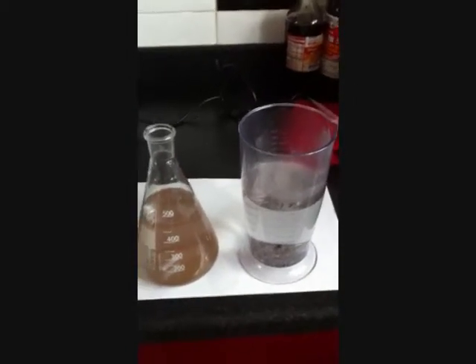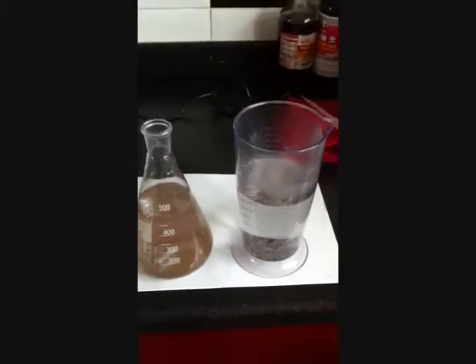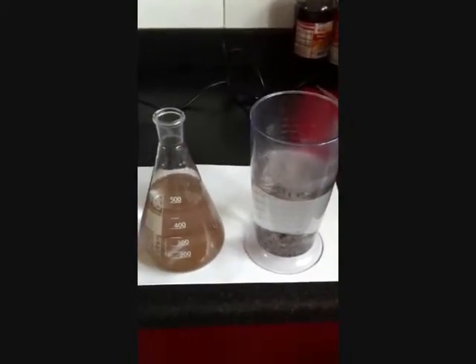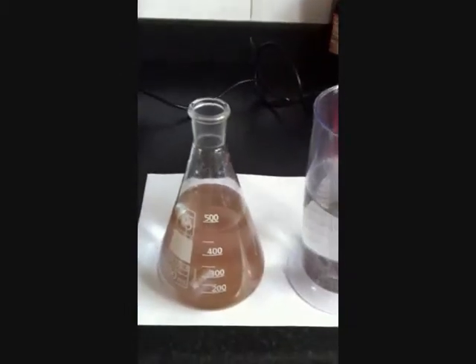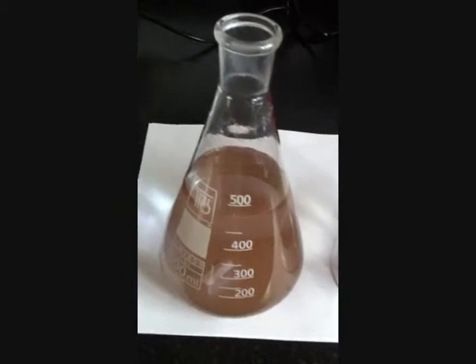As you can see, these are the two attempts at the experiment. On the right here we have got the failed one — you can see it has precipitated and settled down the bottom. On the left here we have got a partially successful one: red colour and a little precipitate. You can see the top of the spin bar is still white. I would not try this because I have used a lot of unknown products in it, but it looks like we have got a result.